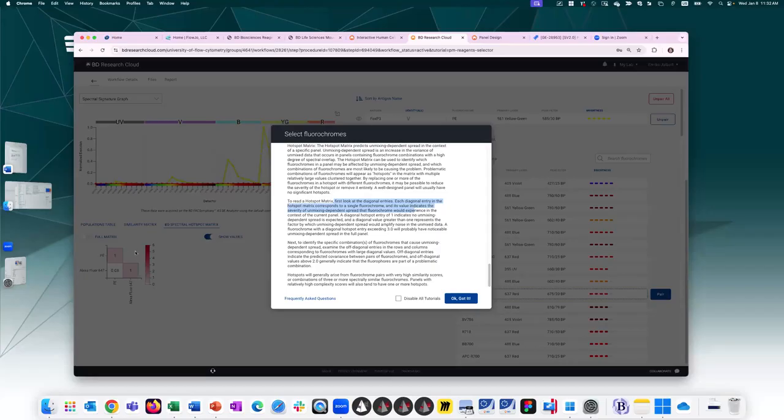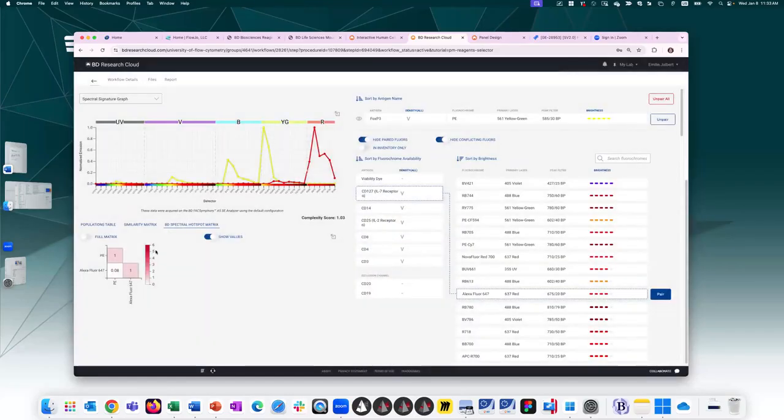A diagonal hotspot entry of 1, which is what we are seeing here, indicates no unmixing dependent spread is expected. And a diagonal value greater than 1 represents the factor by which unmixing dependent spread would amplify the noise in the unmixed data. A fluorochrome with a diagonal hotspot entry exceeding 3 will probably have noticeable unmixing dependent spread. So to read the hotspot matrix, we're looking at the diagonal and we want values of 3 or lower ideally.